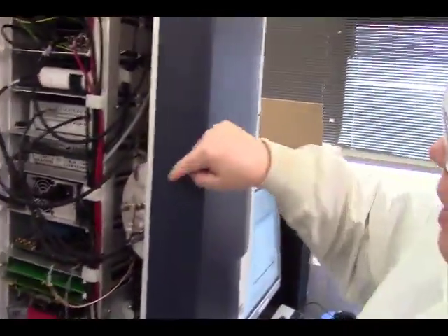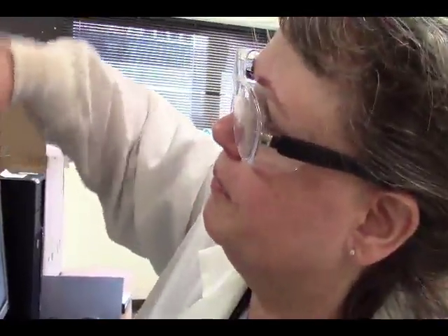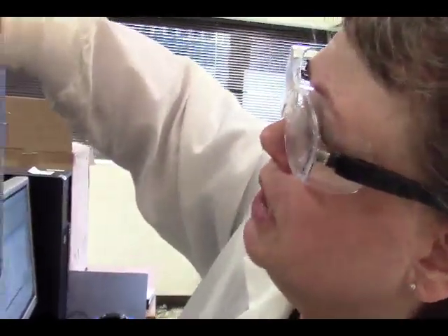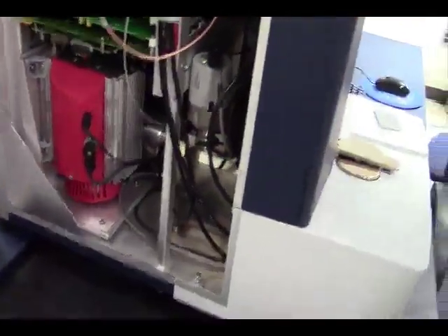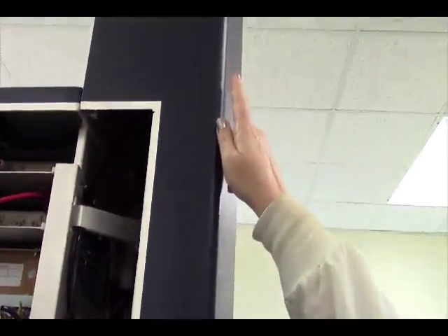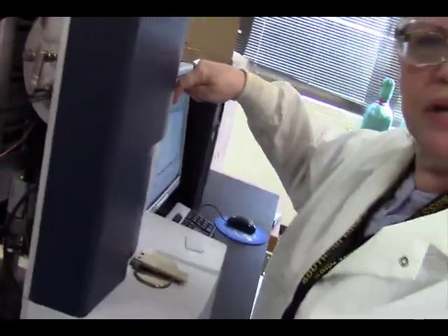Okay? Now, the smaller molecules move faster, just like a marathon race. The big, heavier molecules are a little more sluggish and they take more time. And that's why the time of flight is used for that. Okay? So, linear mode, your ions start here, and they go to the top. Okay? Reflectron mode, they go here, they're stopped, diverted, and they come back down here to another detector.